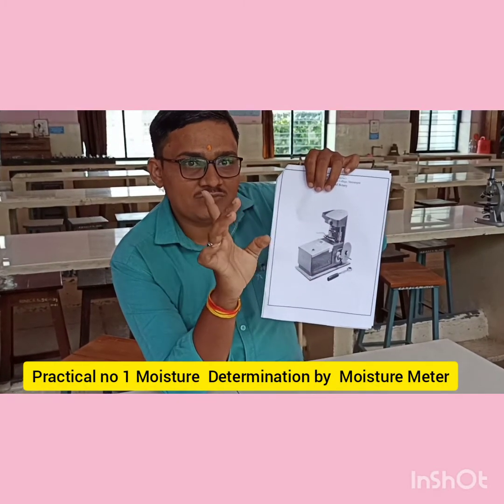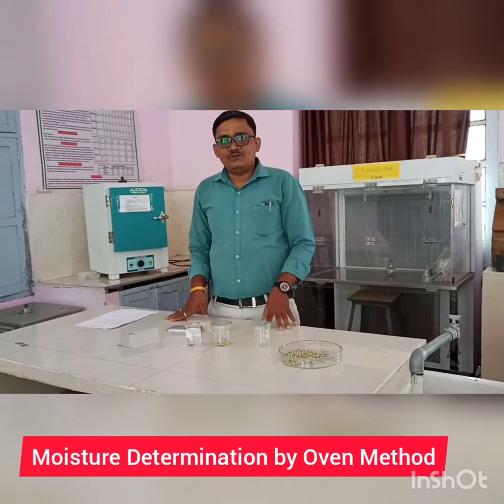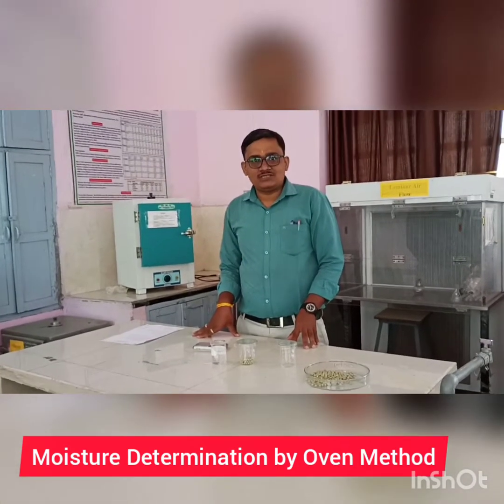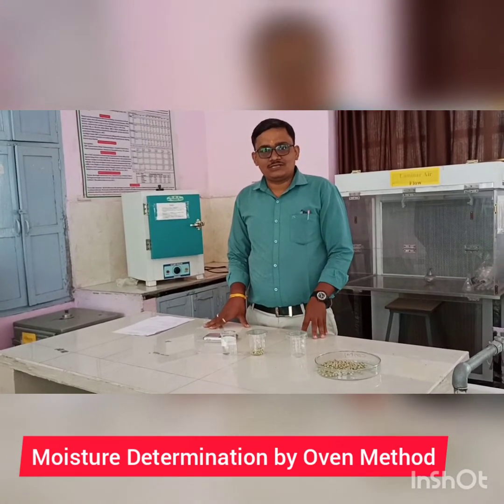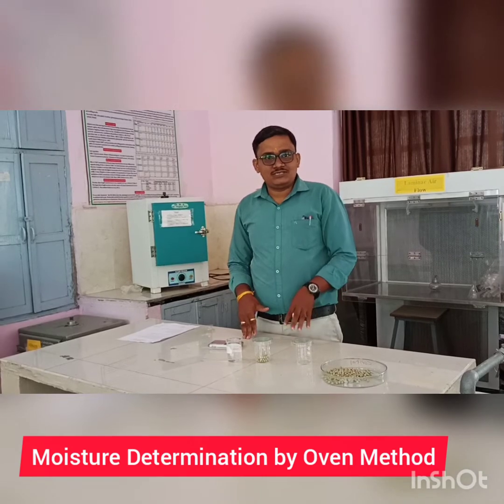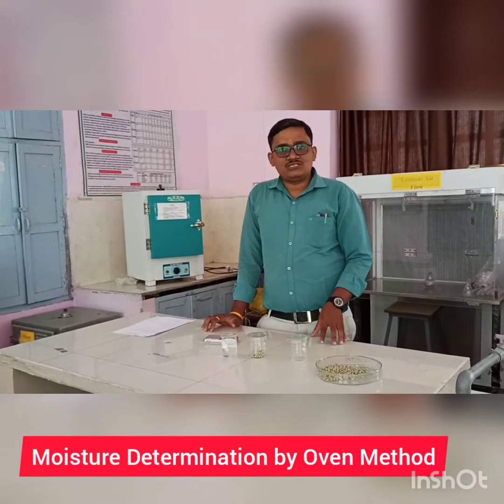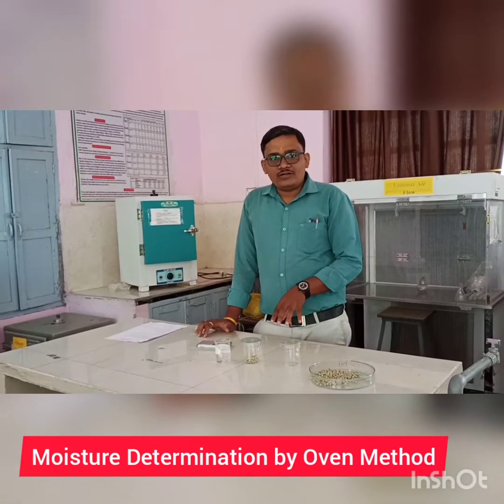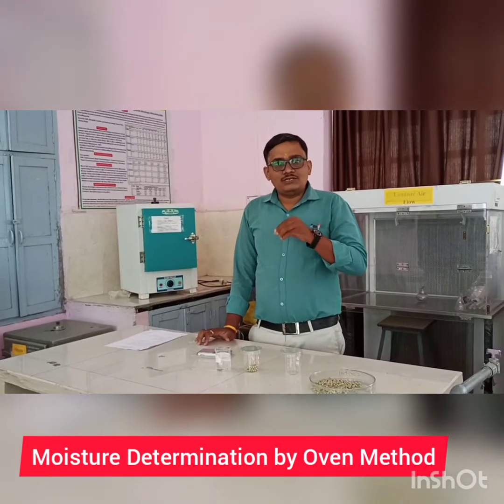That is the first method of moisture determination. Previously we saw moisture determination by the moisture meter method, and the principle of electrical conductivity. In this video we are going to see moisture determination by the hot air oven method. The principle of this method is the determination of moisture by removing the weight of the water content of the seed.